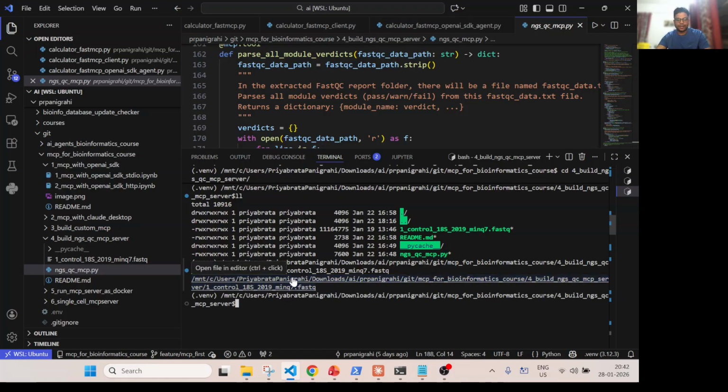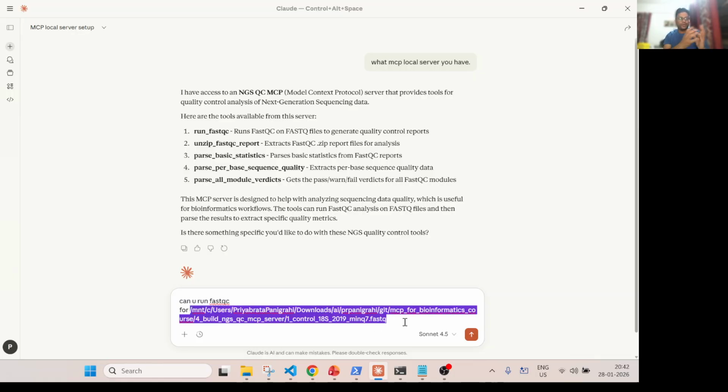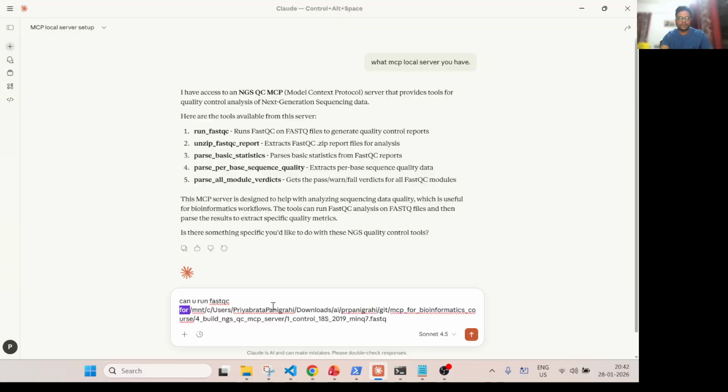Okay, so now one important thing: since my server is running in my WSL, because I have launched it there, I have to give this path. But if you are running on Windows only, then you have to give the Windows path. Okay, so now, can you run FastQC for this sample? Okay, so now let's see what happens.